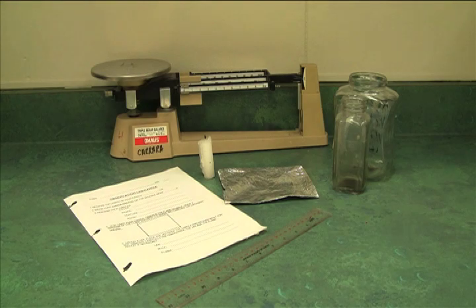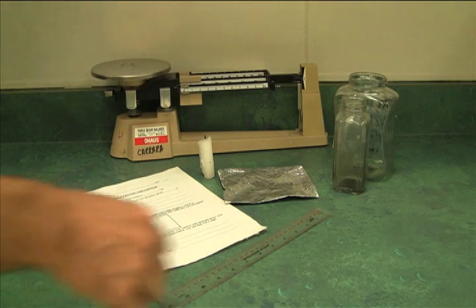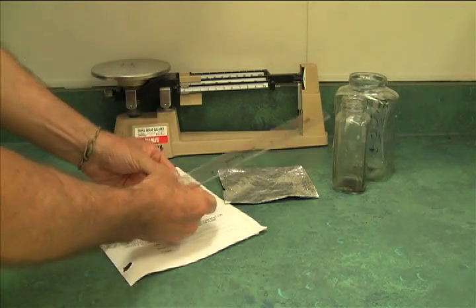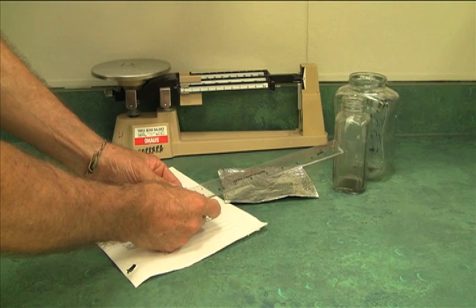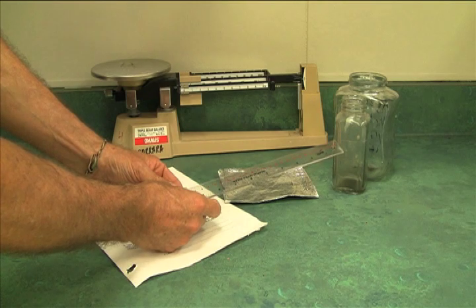Step one tells me I need to measure the length of my candle in centimeters, so I'll do that now. And it appears that this candle, to the nearest centimeter, I'm going to say six centimeters exactly.